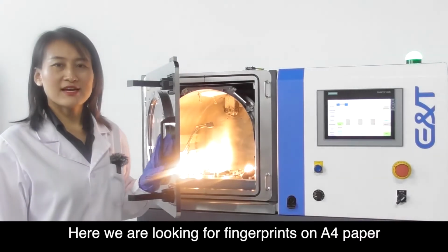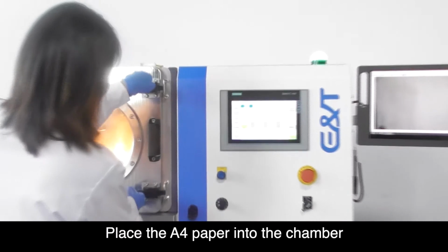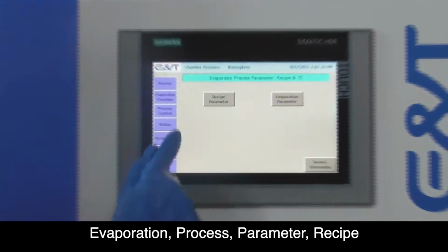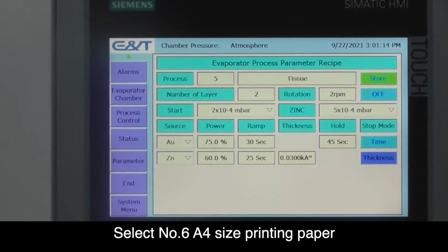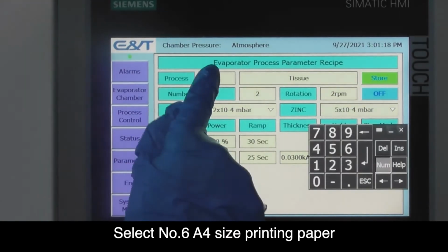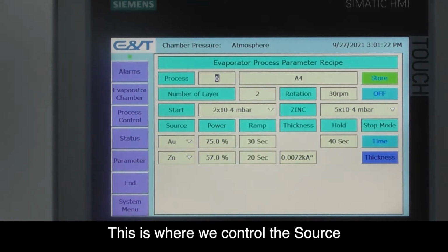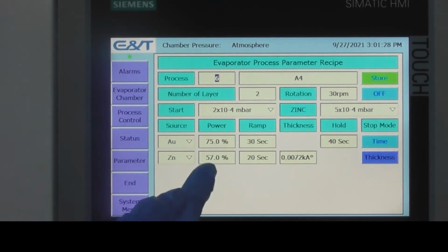Here we are looking for fingerprints on A4 paper. Place the A4 paper into the chamber. Evaporation, process, parameter, recipe. Select number 6 A4 size printing paper. This is where we control the source, power, ramp time and thickness requirements of our program.